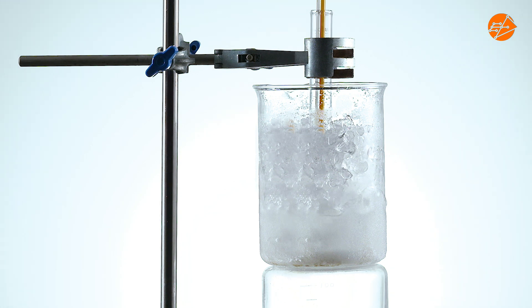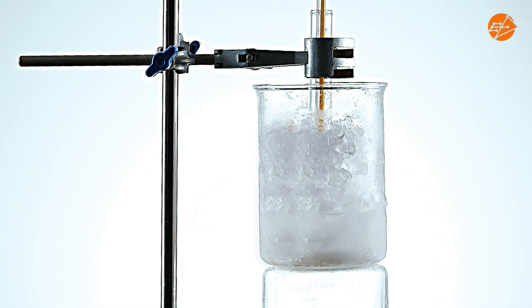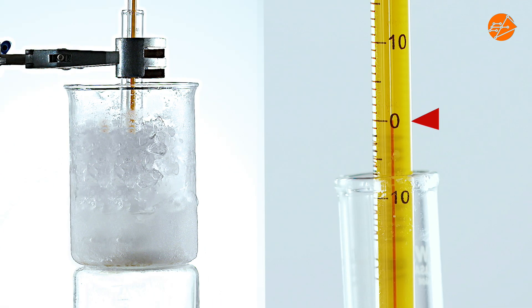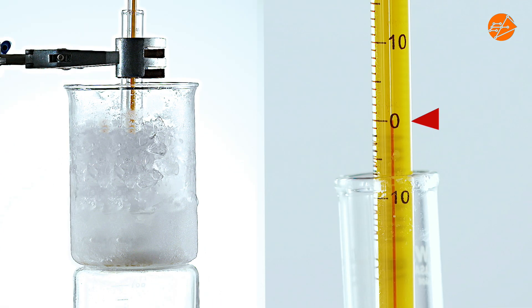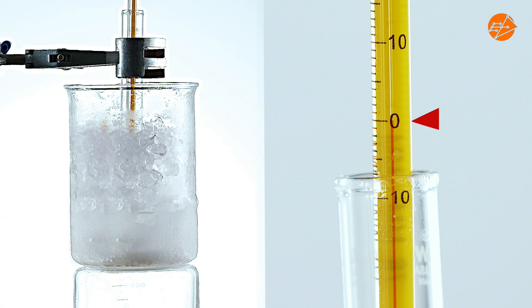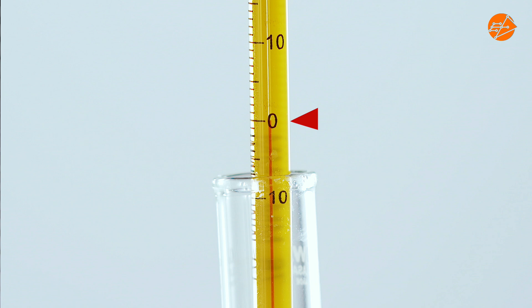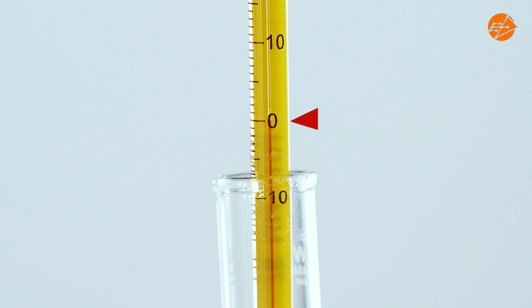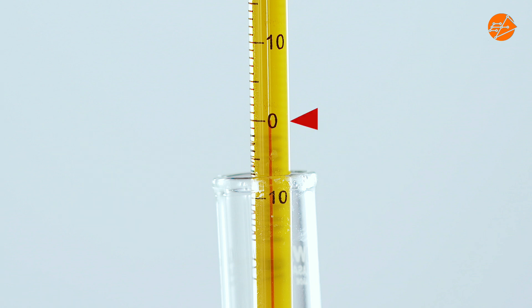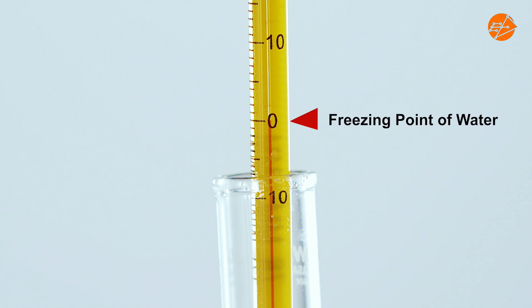The water in the test tube continues to lose heat to the beaker of ice. Now the temperature is zero degrees Celsius. As the water continues to freeze, the temperature remains constant at zero degrees Celsius. This is known as the freezing point. Let's look at the graph.